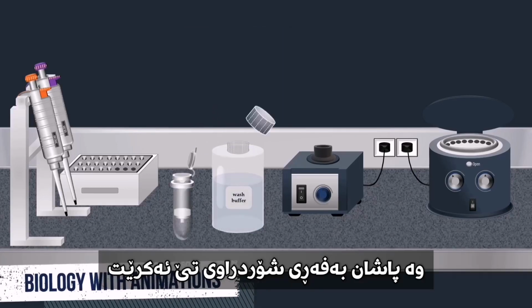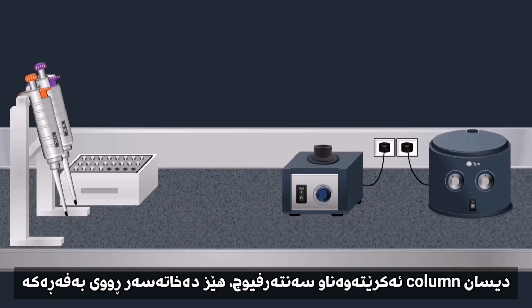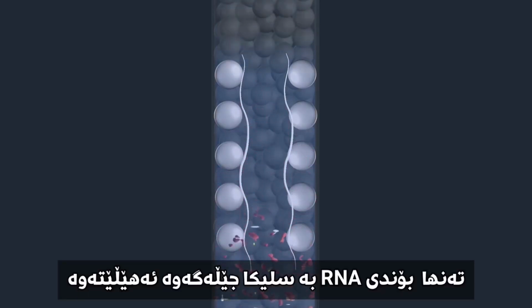Then a wash buffer is added. The column is put in a centrifuge again, forcing the wash buffer through the membrane. This removes any remaining impurities from the membrane, leaving only the RNA bound to the silica gel.